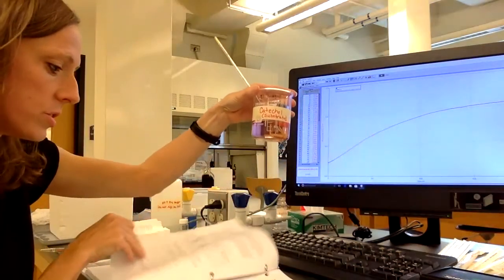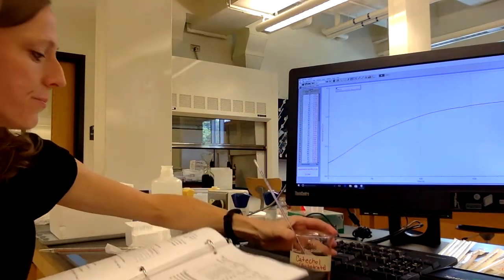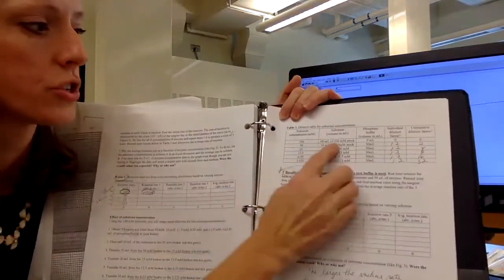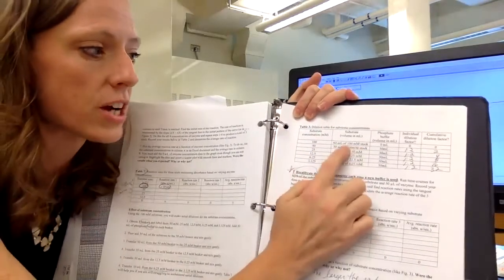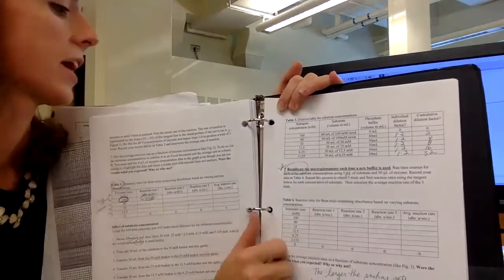And so that's what you do on the subsequent page at table 3. If you look at table 3, you can see that you started with 100 millimolar of our catechol, our substrate, okay? Now we do actually know the concentration of that because we had pre-measured out the catechol.